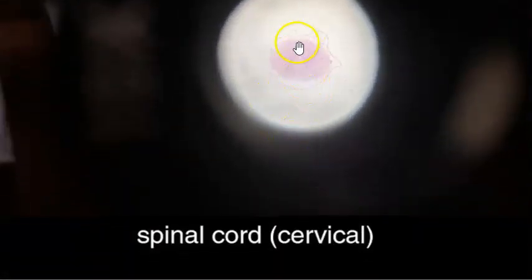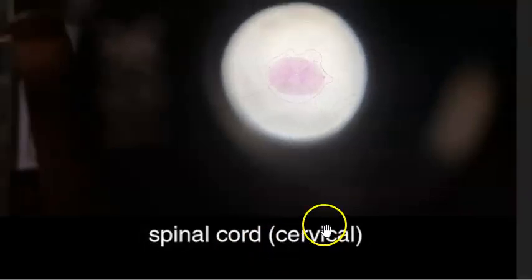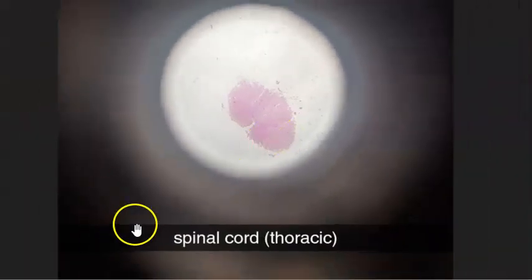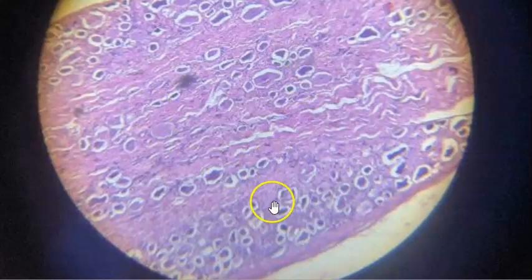This is spinal cord. Very good. You can clearly see the gray, white matter, etc. Right? Spinal cord. This is cervical, they are saying. This one is thoracic spinal cord, they are saying. This is spinal ganglion. The cells are all kind of together, right? And they are almost circular, is it?